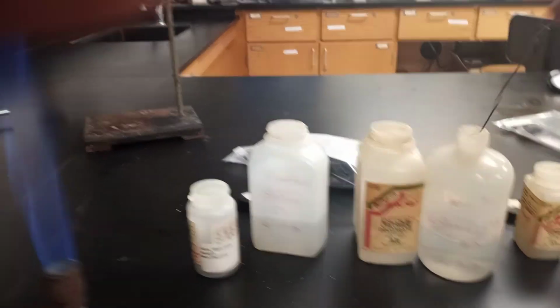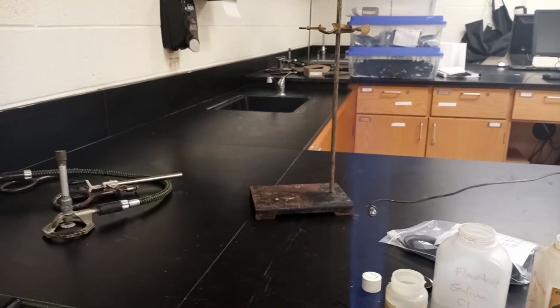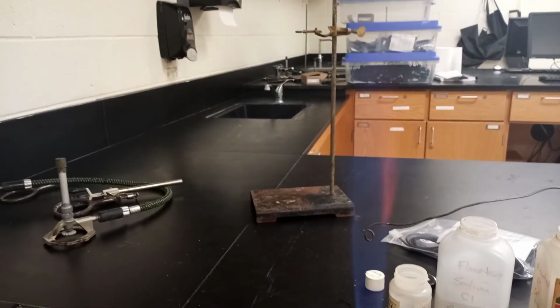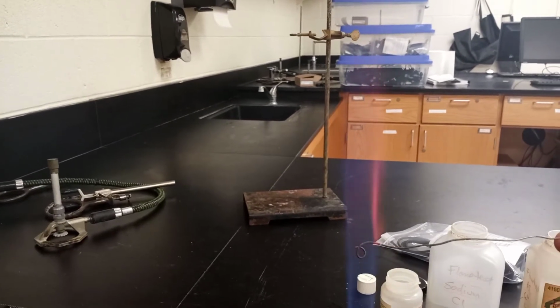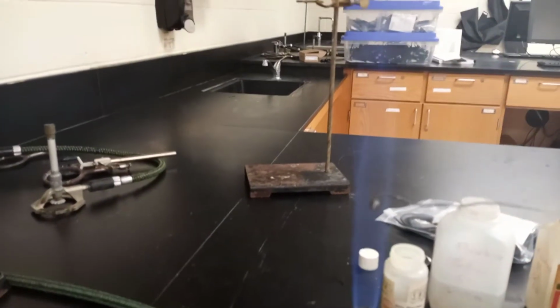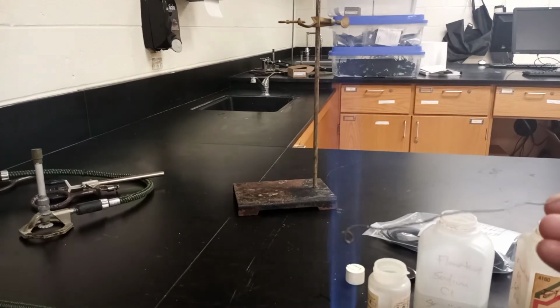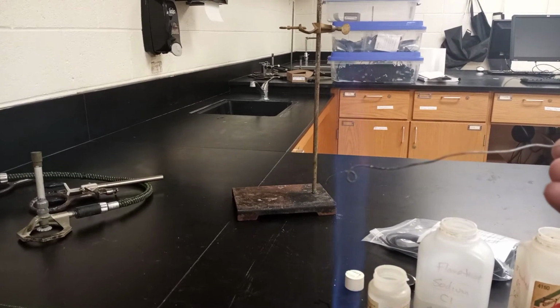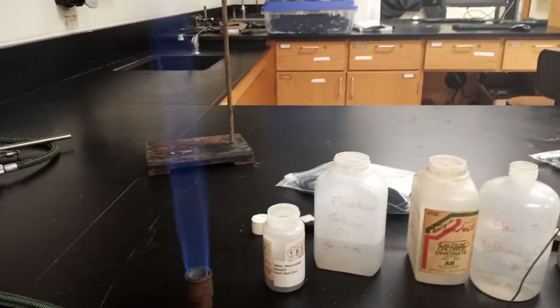Okay, looks like we had lithium once already. Let's do it again because that's my favorite. All right. And we had a purple last time. We get the purple again. Not purple, but this reddish purple color. Not the best. All right. One more time just to make sure we got that. 2 lithiums. I saw a hint of it the last time. There's very little. Anyways, all right, so let's go to the next one.